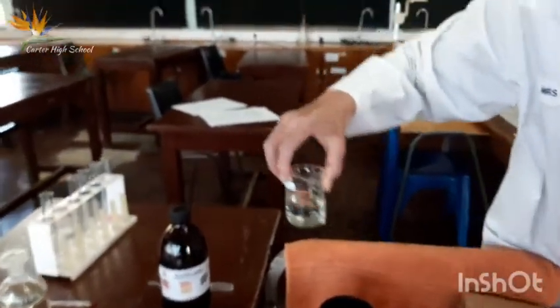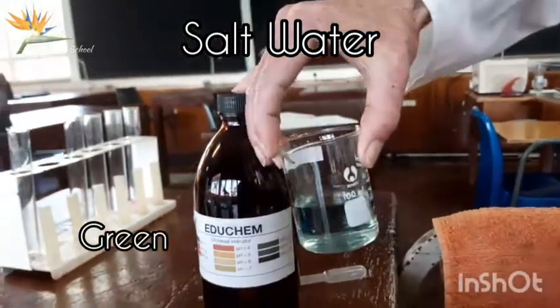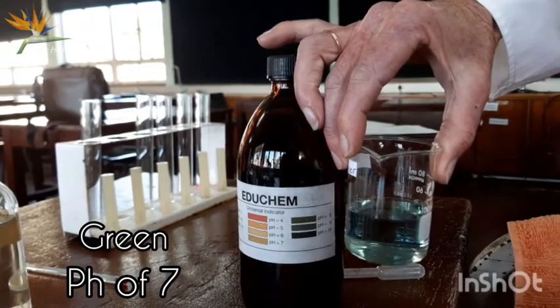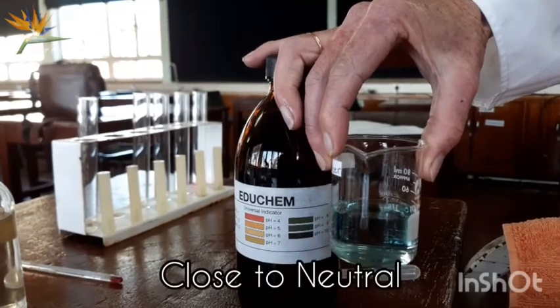Right, moving on to the salt water. Let's give this a stir. This is definitely green. All right, green right over there. pH is 7, almost. Our water is actually almost turning a little bit blue. It's like a darker green. Which suggests there are some chemicals in our water, but it's close to neutral.